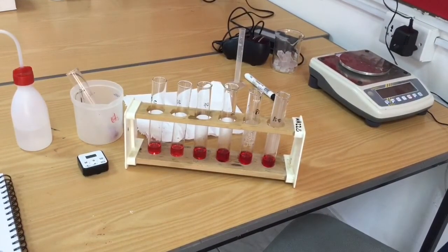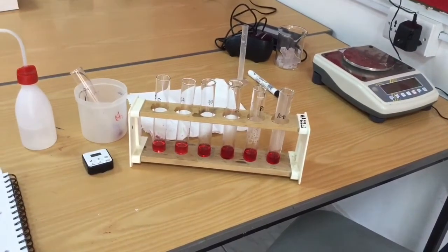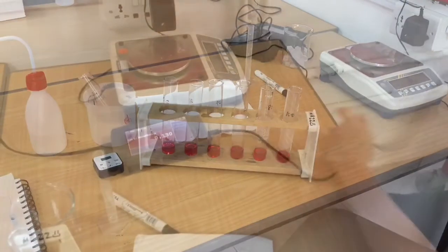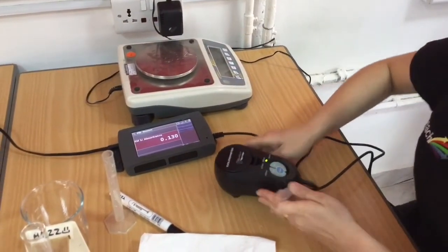Set my timer for 10 minutes, and after 10 minutes, I work in the same order and I quickly decant my liquid off from the pellet into another boiling tube to stop that leakage.